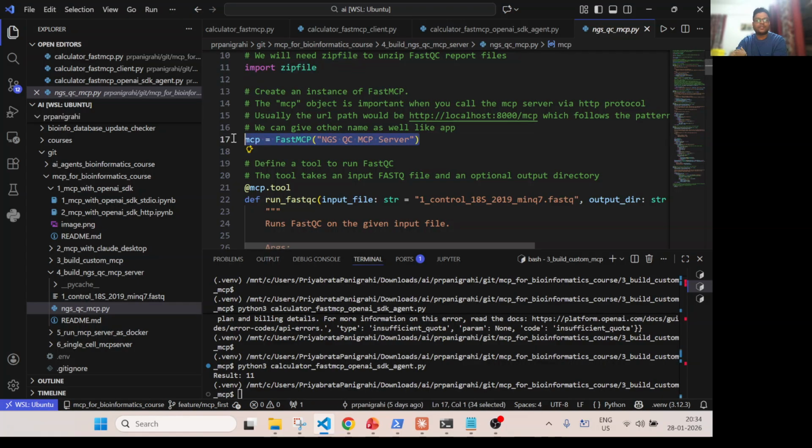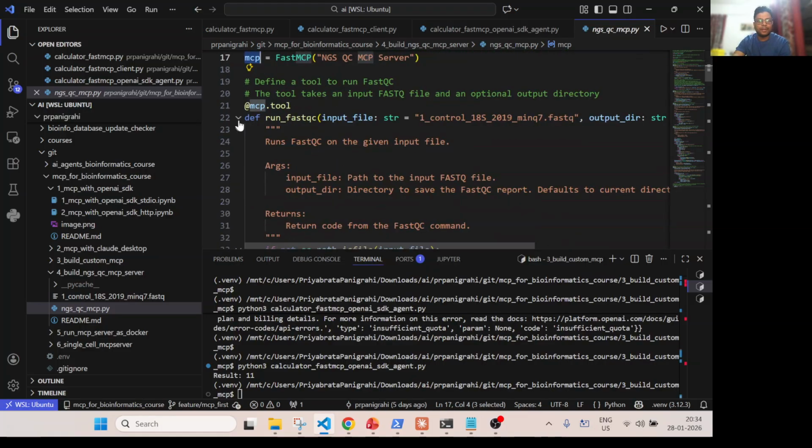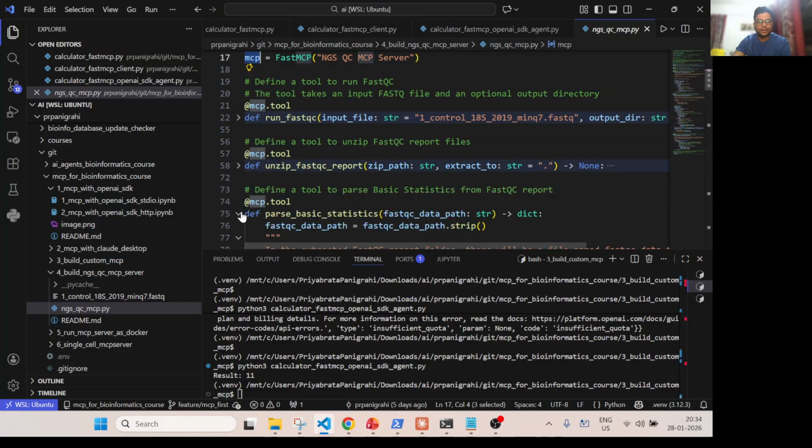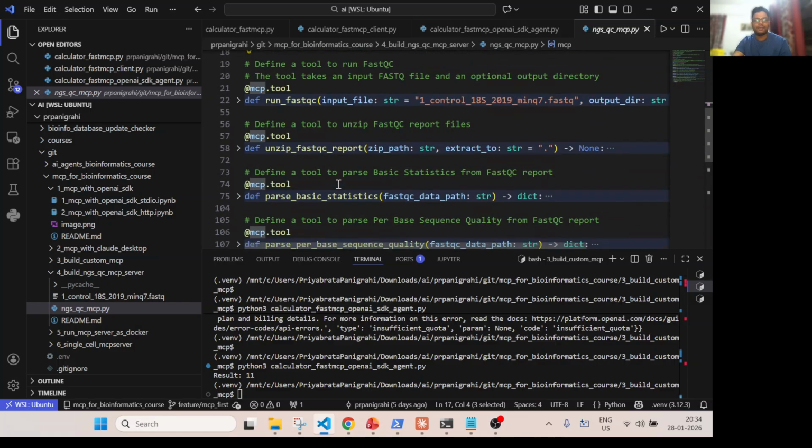And this is where we created the FastMCP object. Very simple: FastMCP, and it is given a name here, NGS QC MCP server. This object name, mcp, is important. Now I am simply defining a few Python functions. Let's see what I have defined over here. I have defined five Python functions.